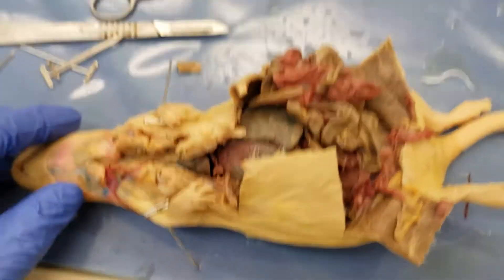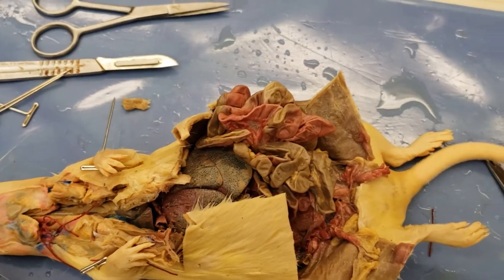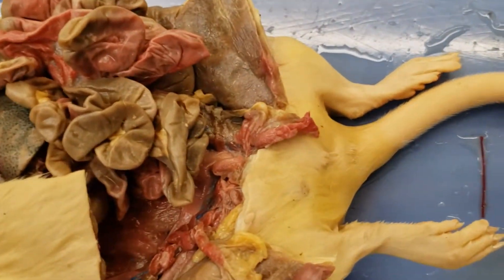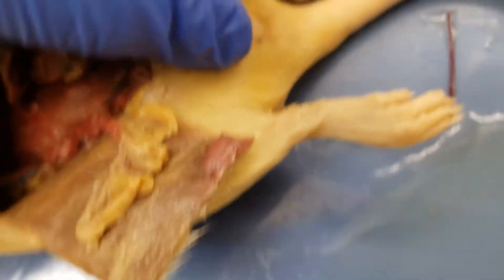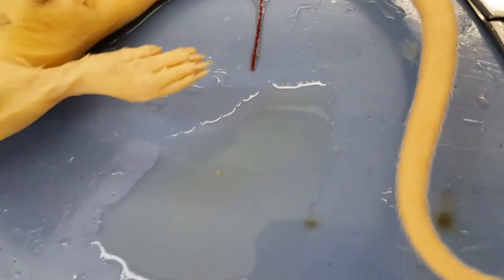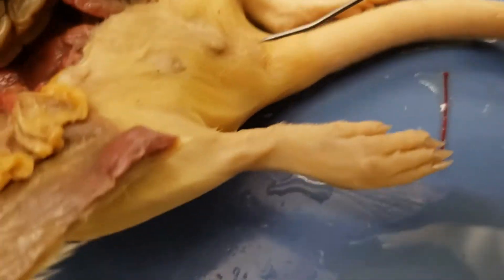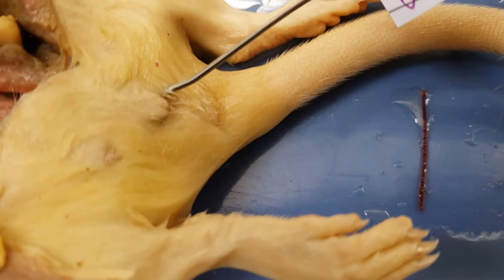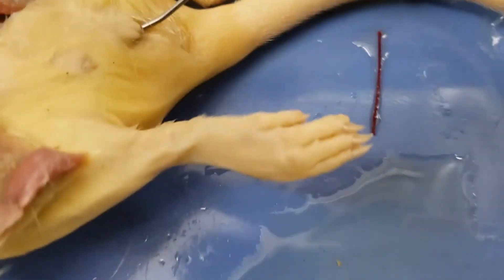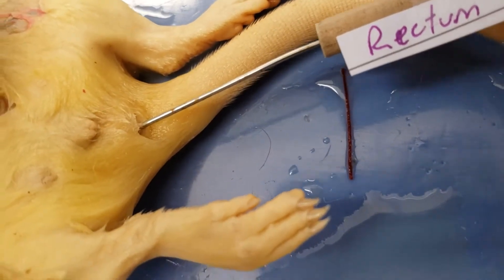One of the first things you can do pretty easily is identify gender. So is it a male or a female rat? You go down here towards the end, you can check the number of openings and see there's a rectum and a vaginal orifice. So the vaginal orifice opening will be right there in that region. And next up we have the rectum, part of the digestive tract. You can get a little peek of it — that's the rectum, right there at the base of the tail.